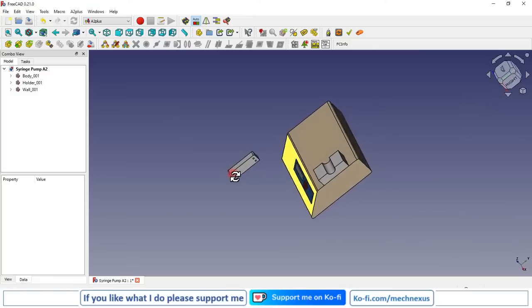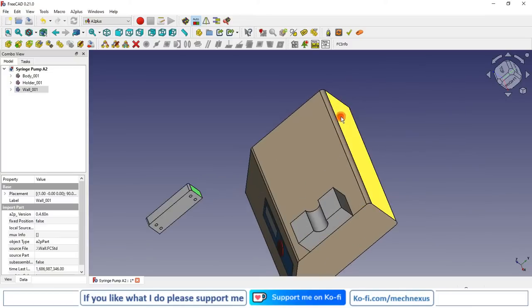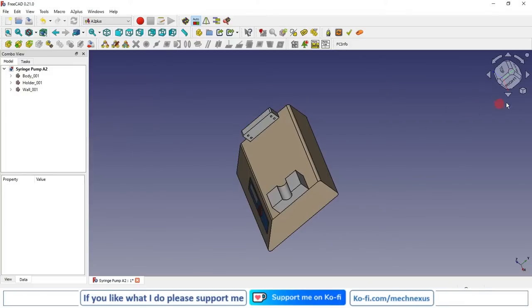So it is also a 23 mm. So I will select this face and this face and give the constraint, and I will give it 23 mm minus, and I will accept it.